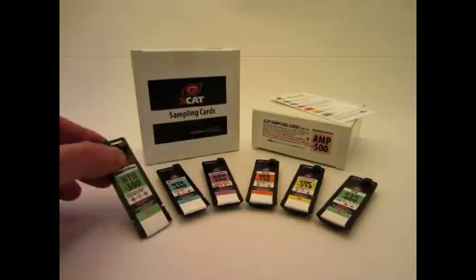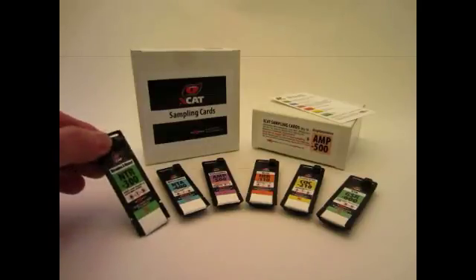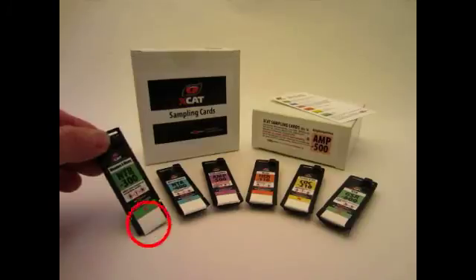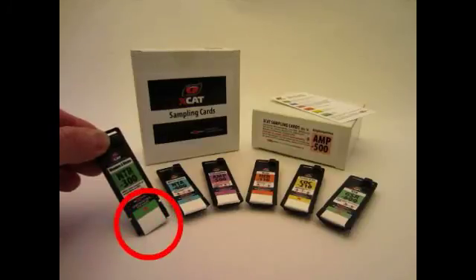The sampling card labels are color-coded and clearly marked with card type. The sample collection area is located directly below the label.